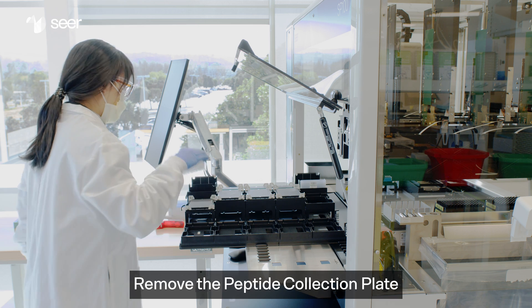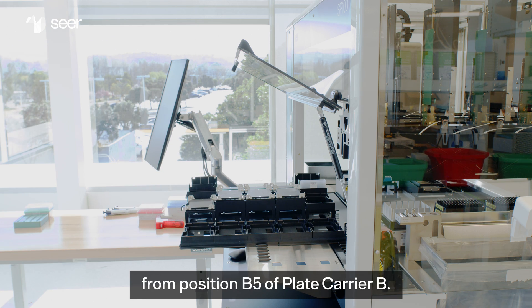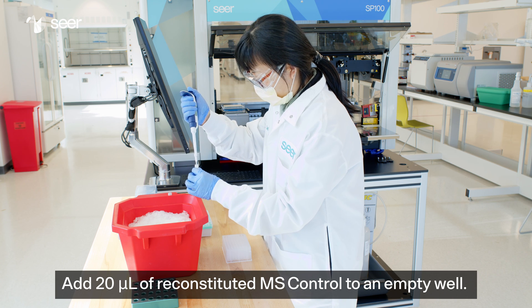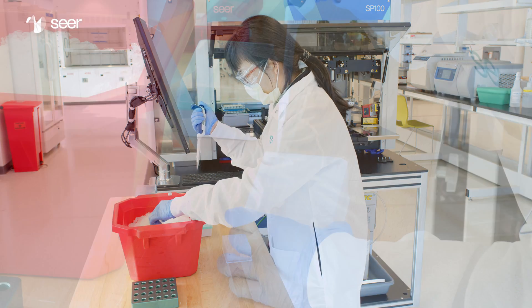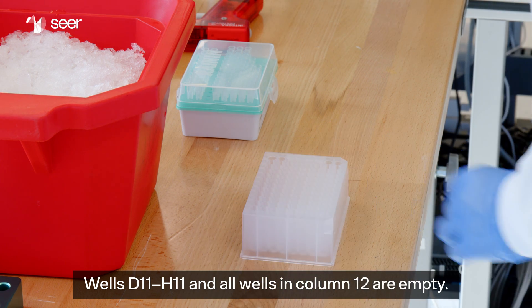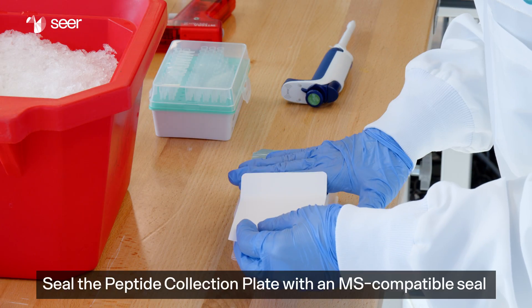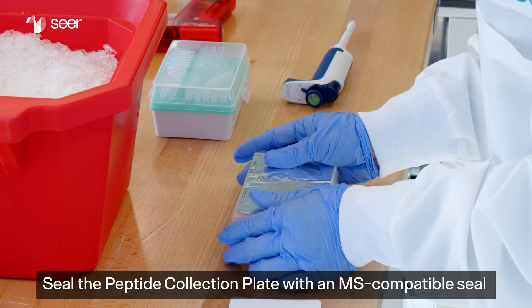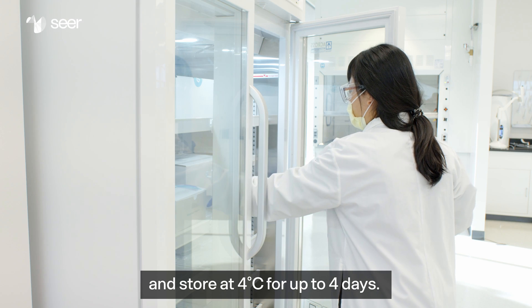Remove the peptide collection plate from position B5 of plate carrier B. Add 20 microliters of reconstituted MS control to an empty well. Wells D11 to H11 and all wells in column 12 are empty. Seal the peptide collection plate with an MS compatible seal and store at 4 degrees Celsius for up to 4 days.